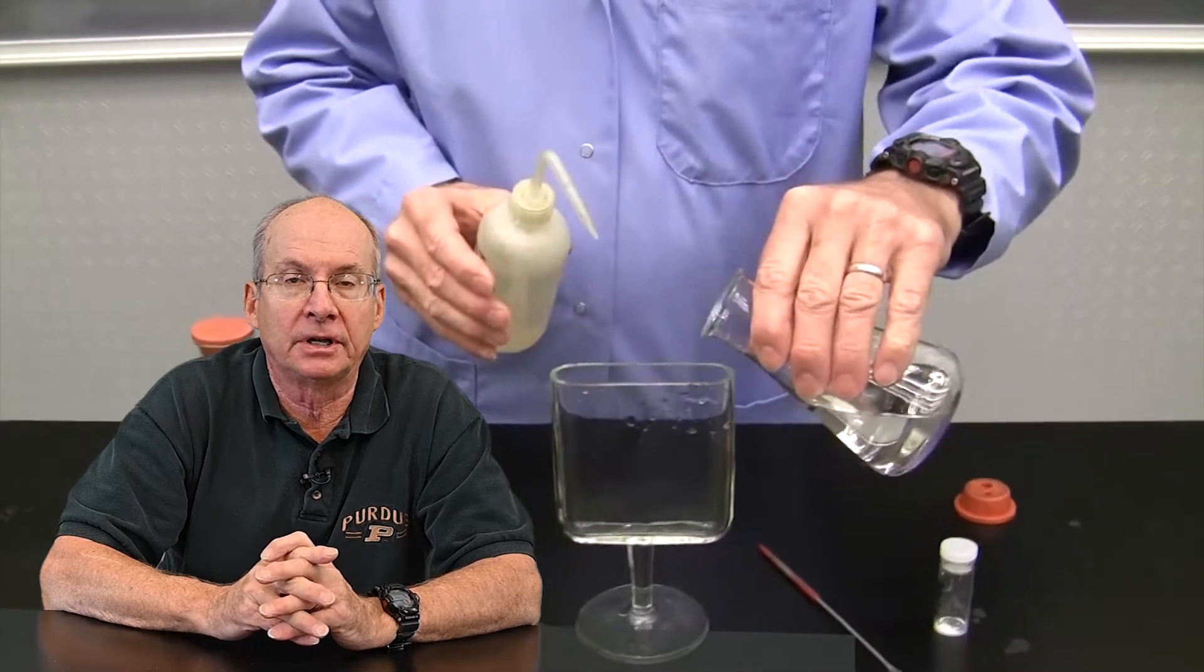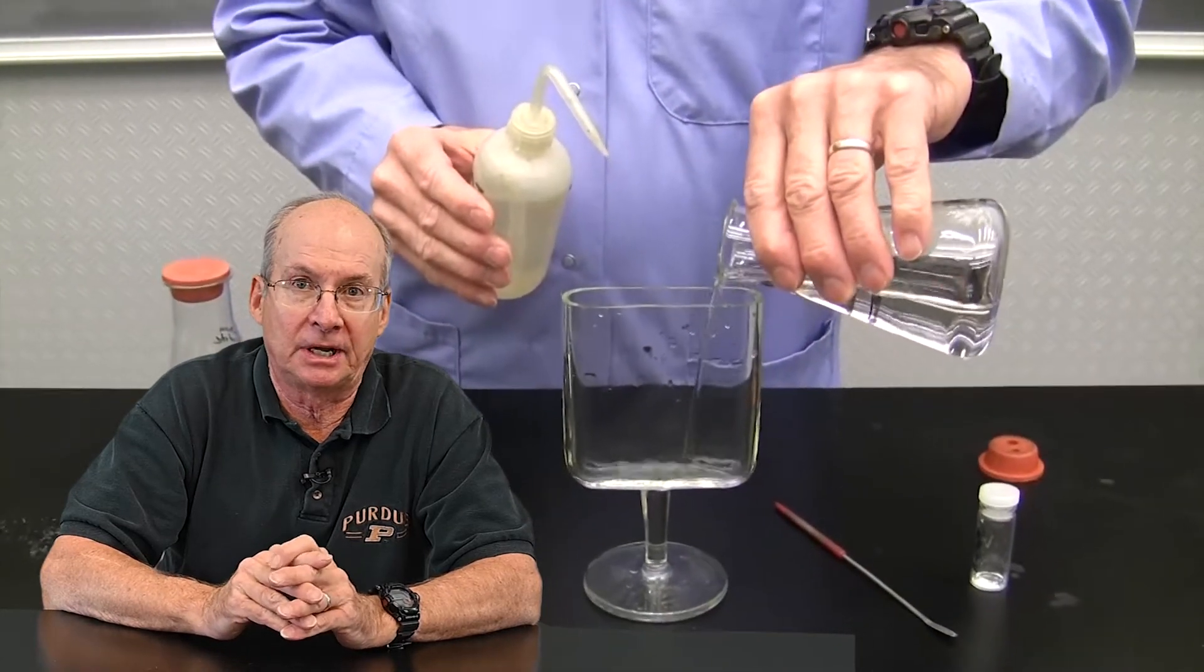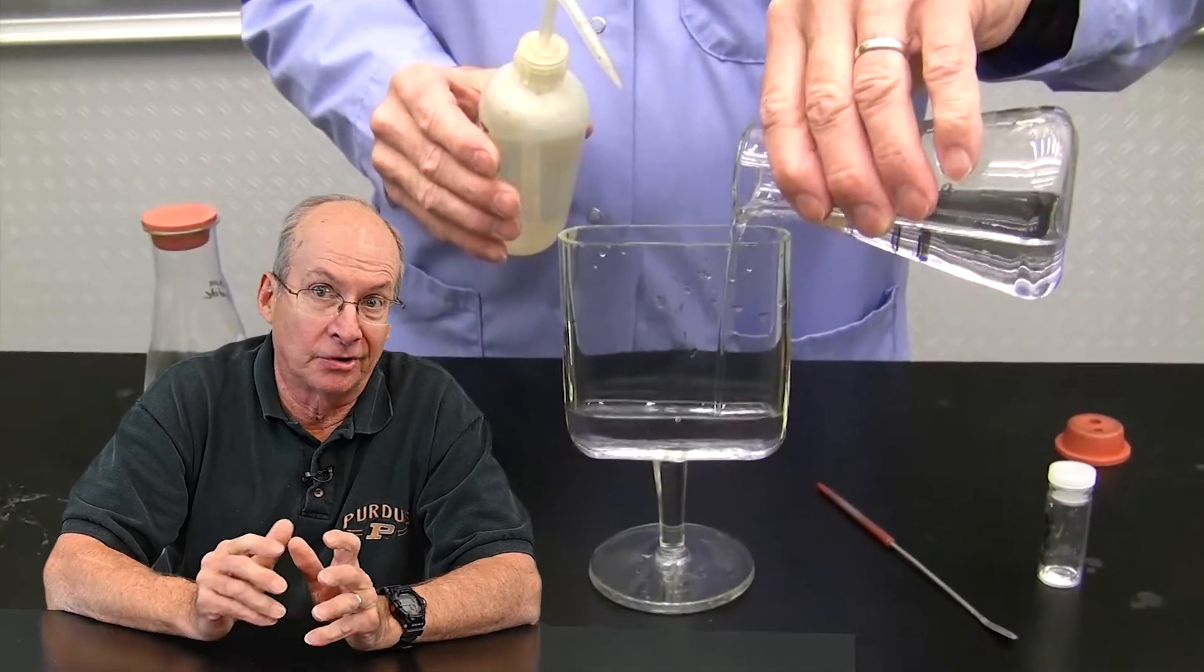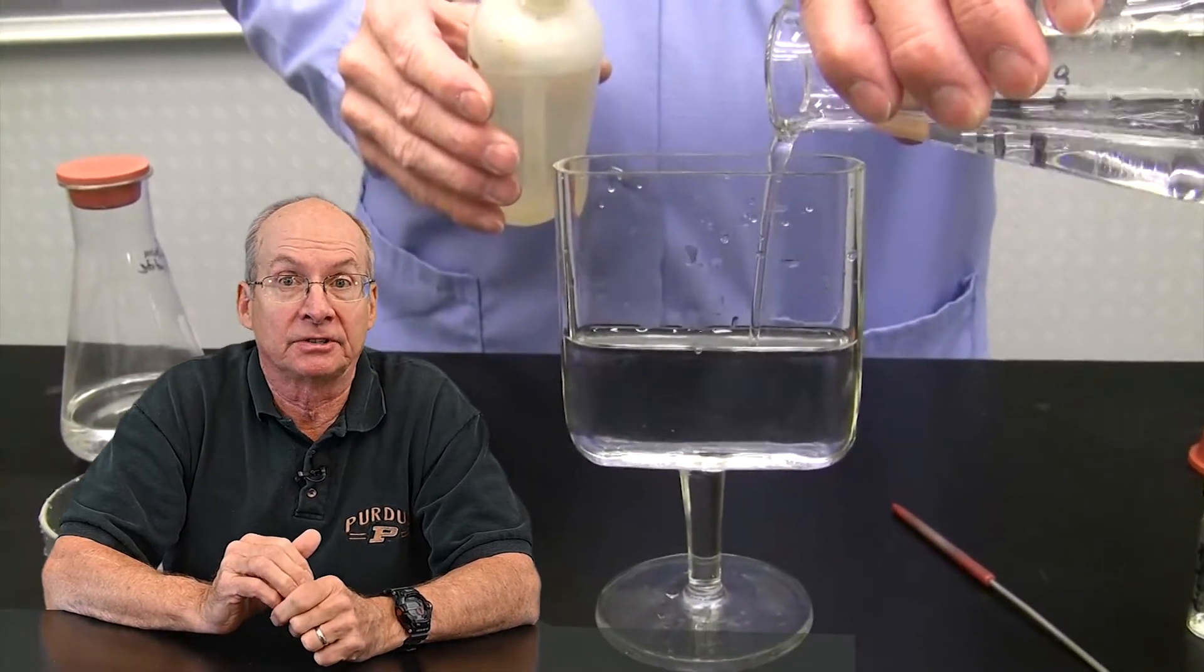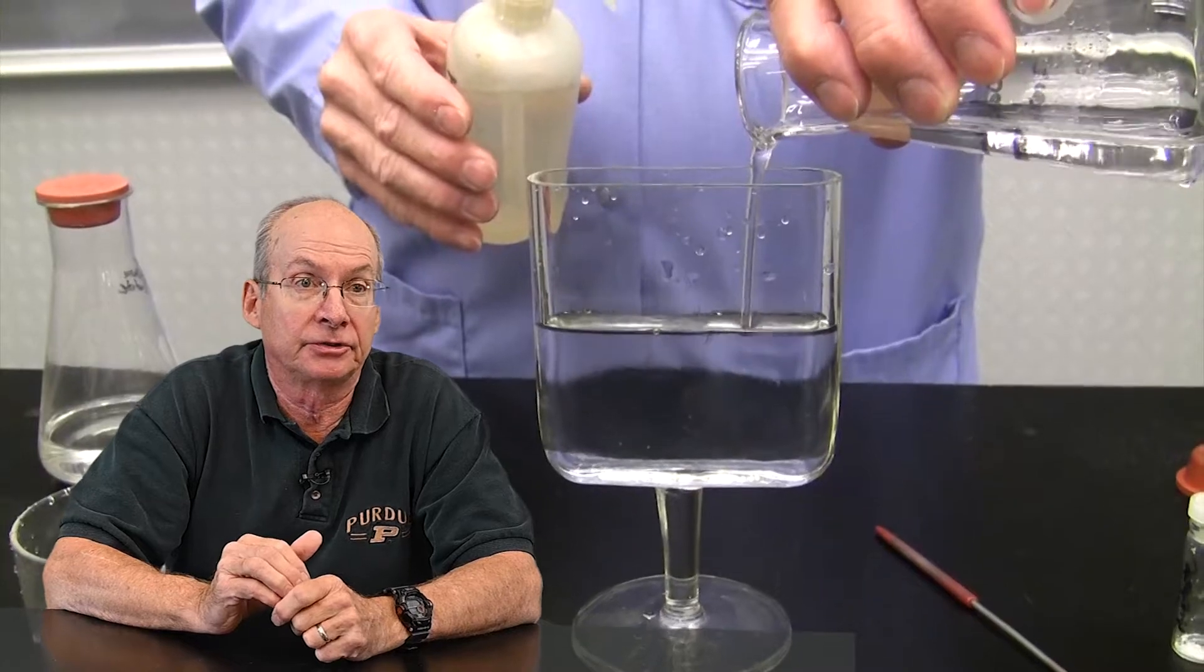Then what you have to be careful of is that you don't contaminate it with anything, and so the longer you sit it around and expose it to things, it'll get dust or things like that and that will seed the solution.